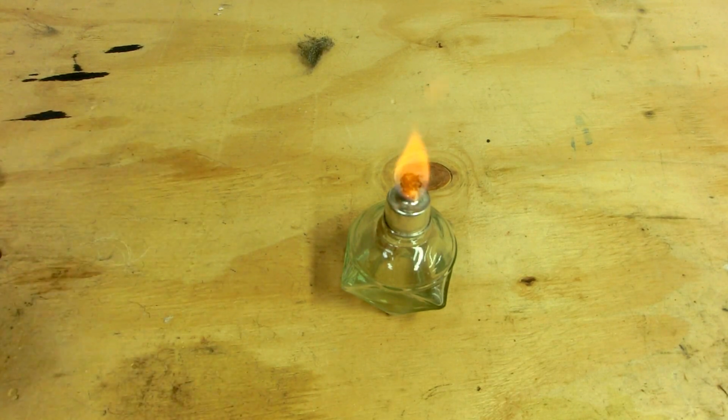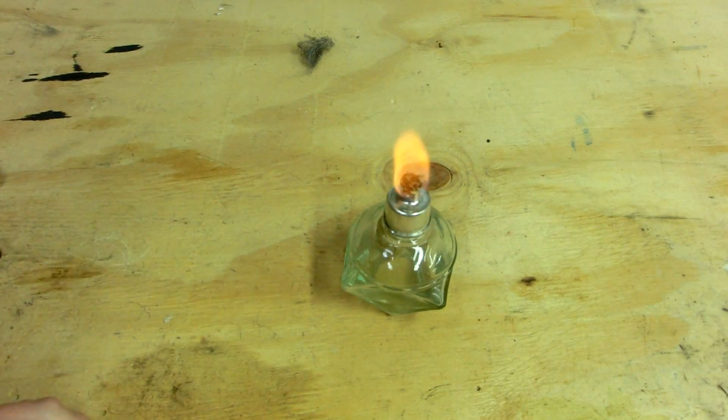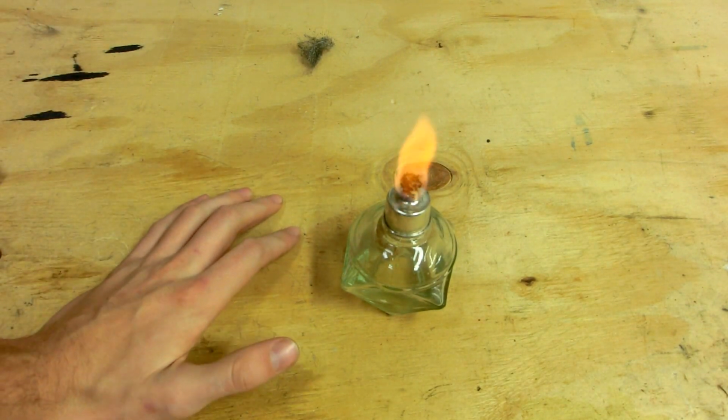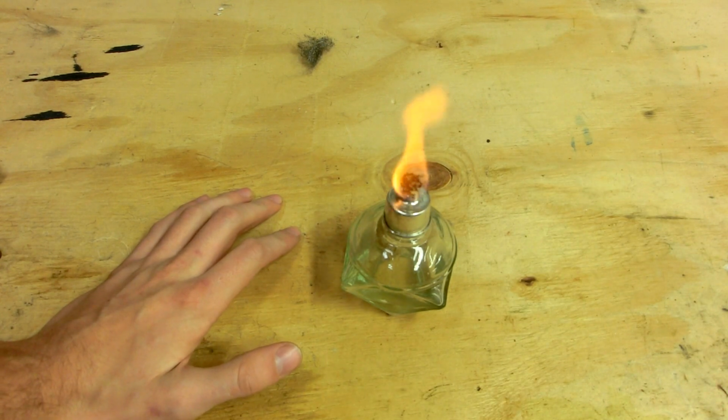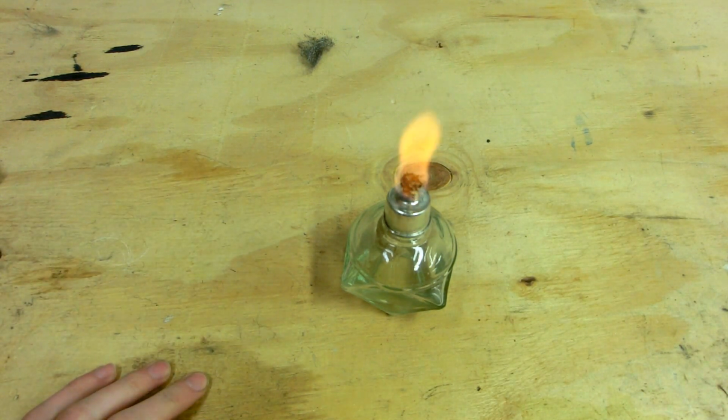Now, this can't be done with mechanical means, because if you do that, the chunks end up being too big, and then once you start getting small enough chunks to spontaneously ignite, they do so. And that can be seen when you're grinding metal parts. You see little sparks flying off. And that's partially due to heat caused by friction, and partially because the particles are so small that they spontaneously react with air. But not all is lost, because we can in fact synthesize fine enough iron powder to ignite in air. We can do it chemically. And so in this video, I will show you how to do that.